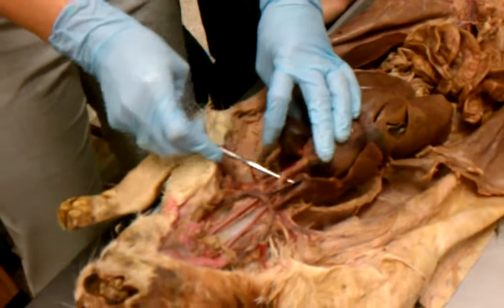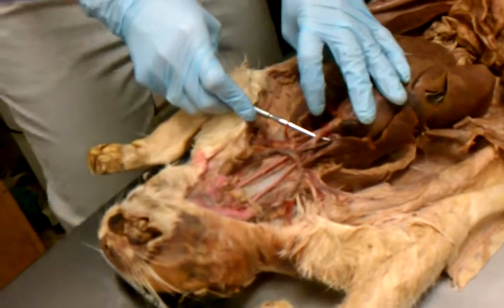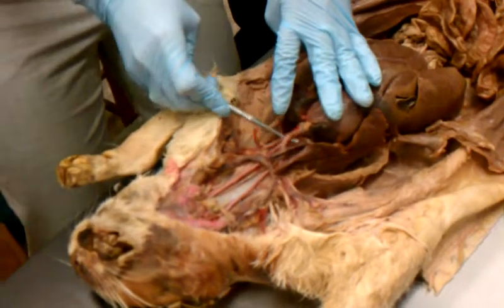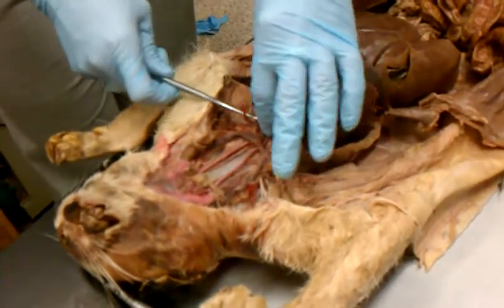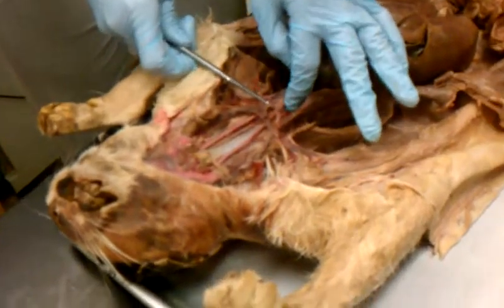This big old branch on the right is the brachiocephalic artery. So these are all arteries. So here's your aorta, aortic arch, left subclavian, and brachiocephalic. Then what do you think the brachiocephalic does? It branches. These are all going to branch. Once it branches, you're going to ignore all this, branches right here. Do you guys see that?